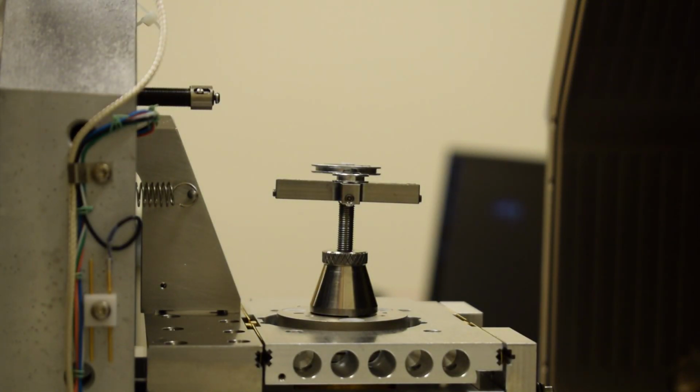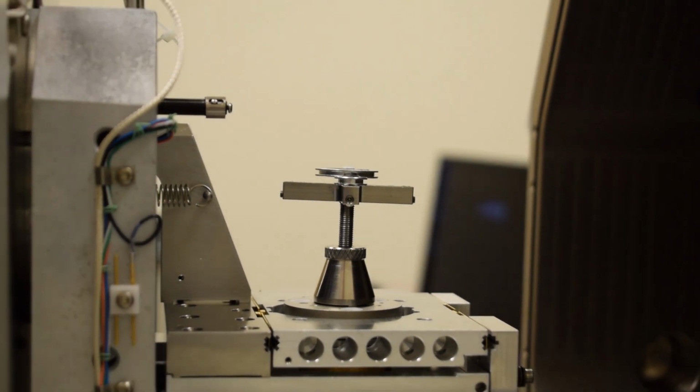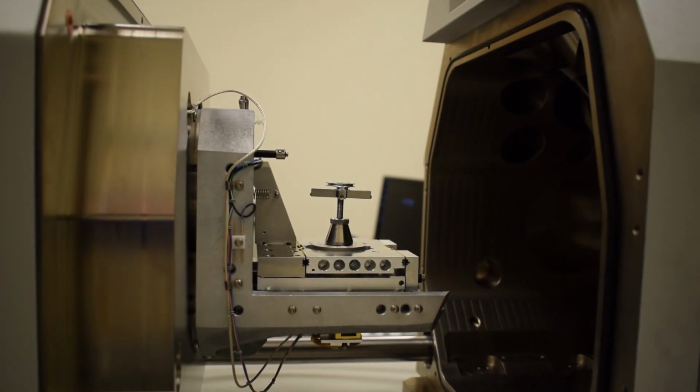So now we're ready to close the door of the microscope and pump the chamber down. When you do this, it is a good idea to look at the CCD camera on the microscope user interface. The CCD camera will show you when you close the door if you have a sample that is going to potentially hit the lens. So I'm going to lower our mag here a little bit on the one camera.